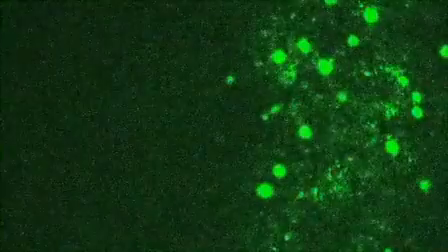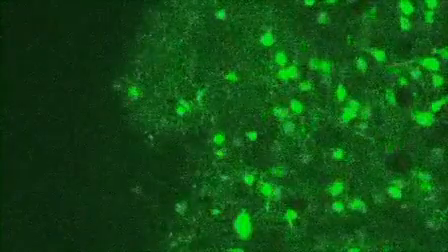Cortical network activity is recorded using time-lapse multi-photon imaging. Cells are detected within the network by making a 3D stack of images through the region of interest.